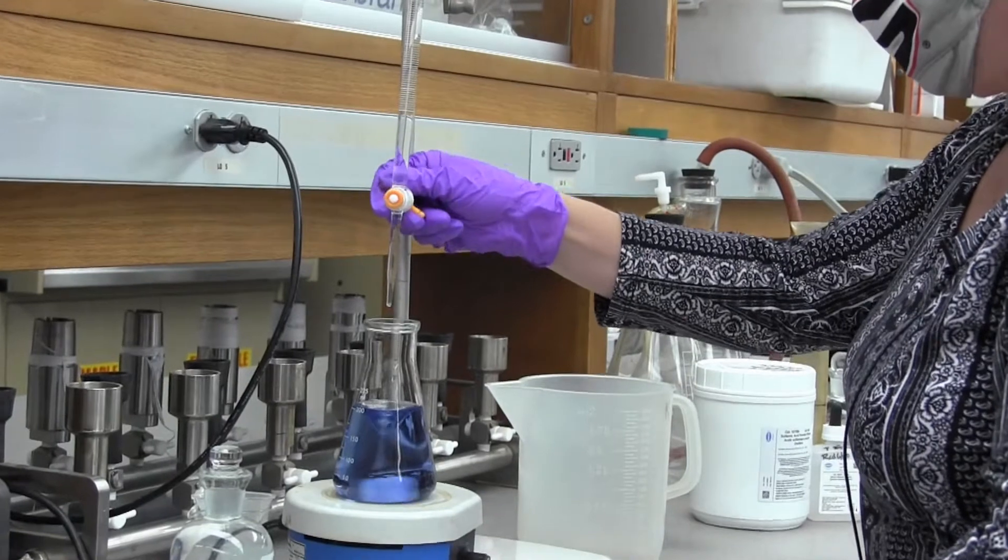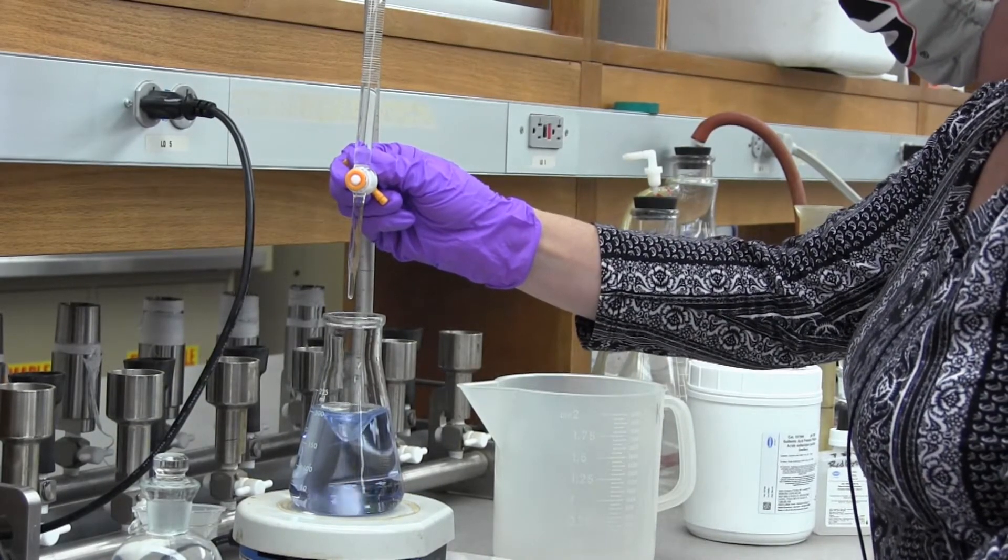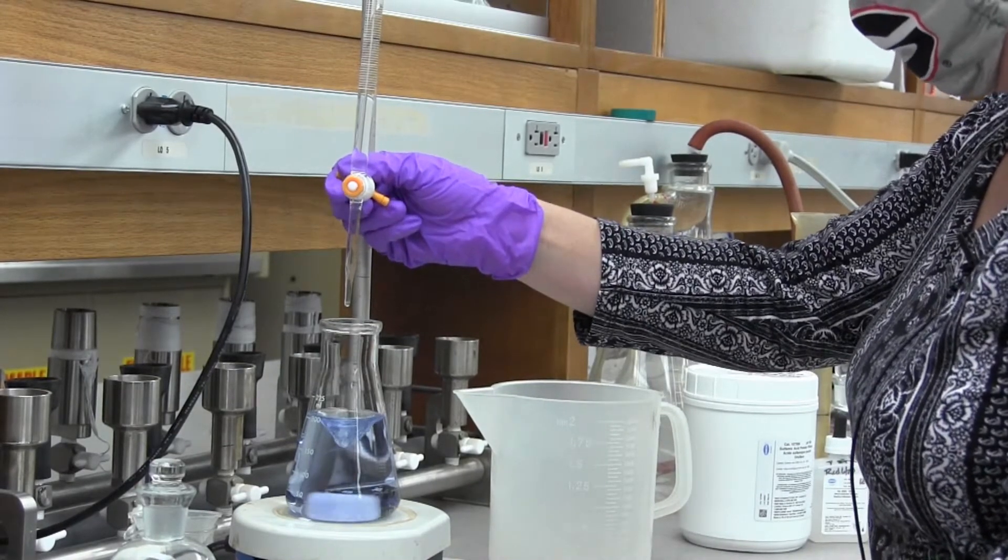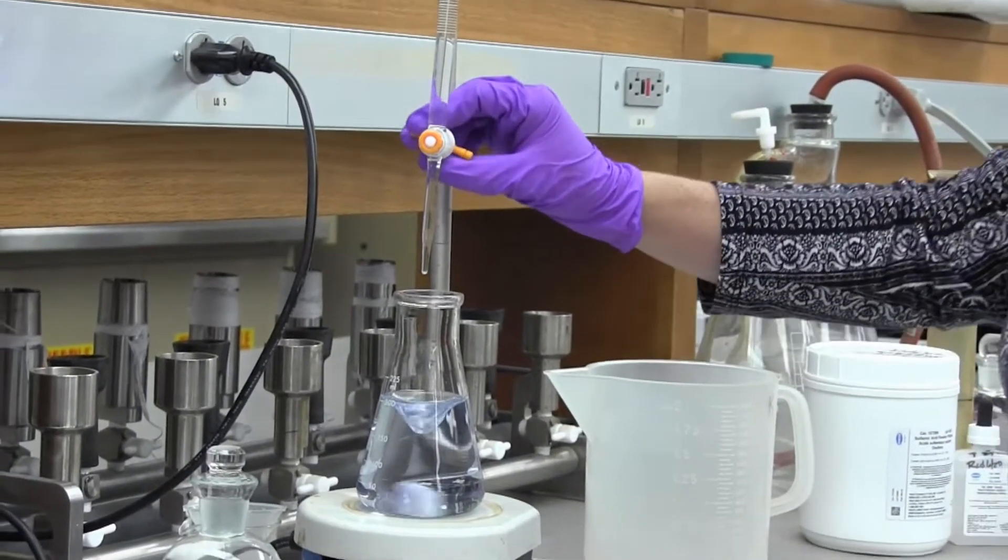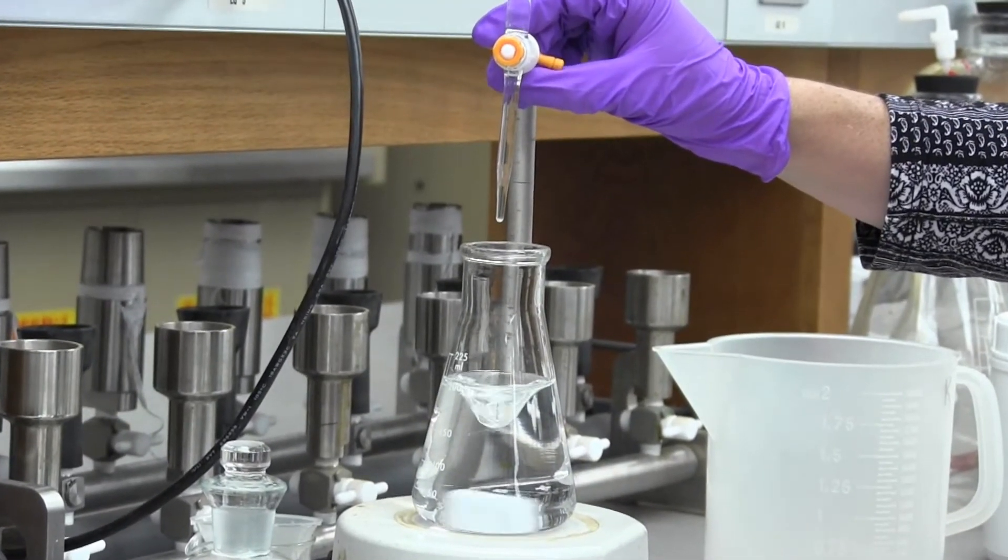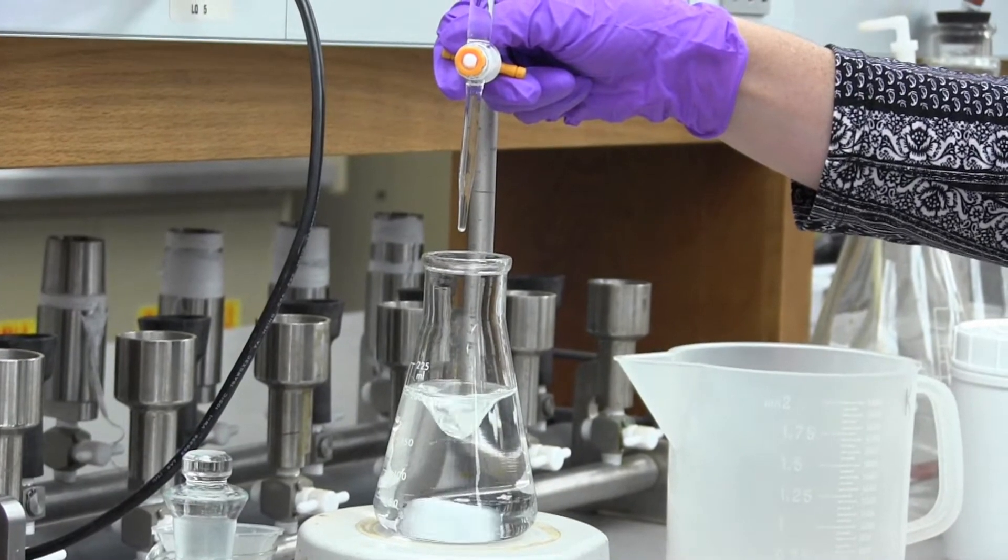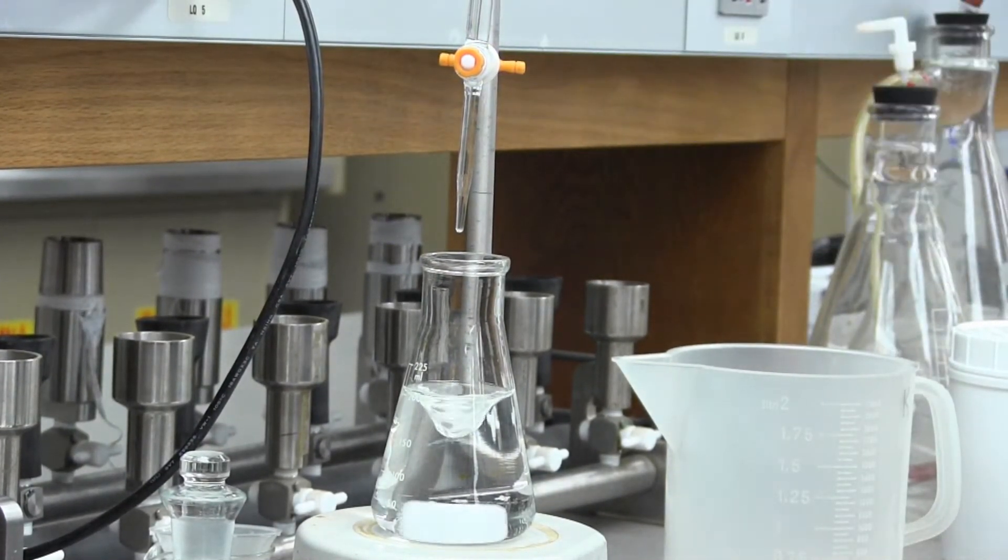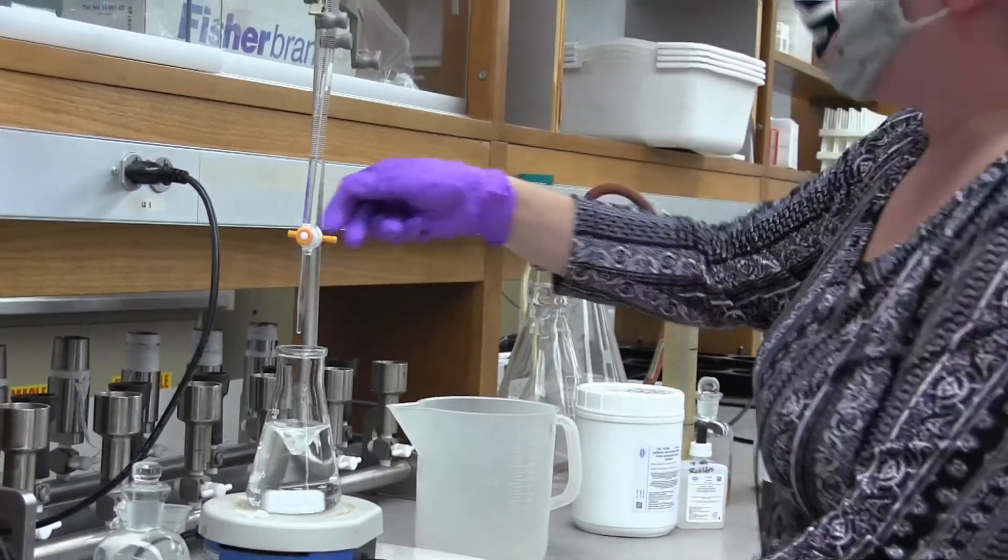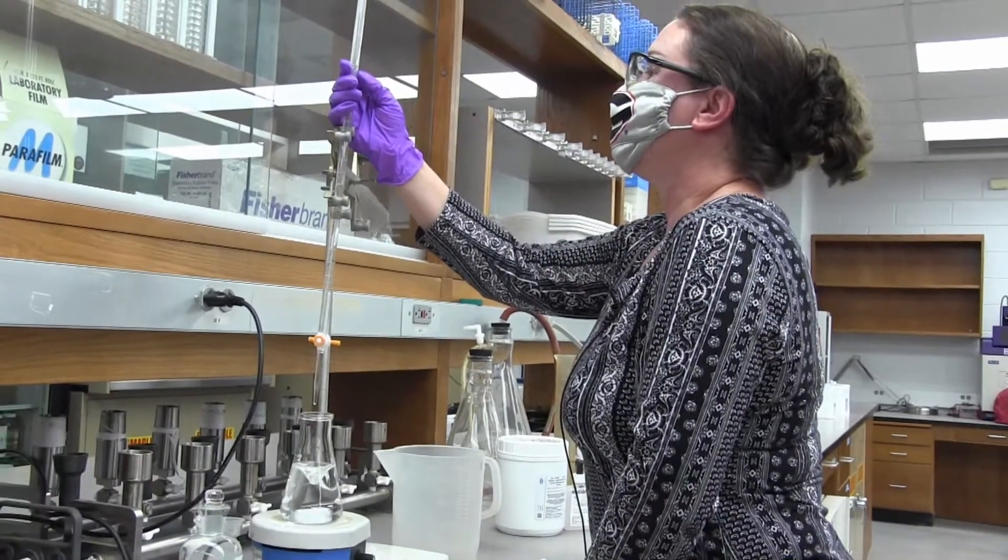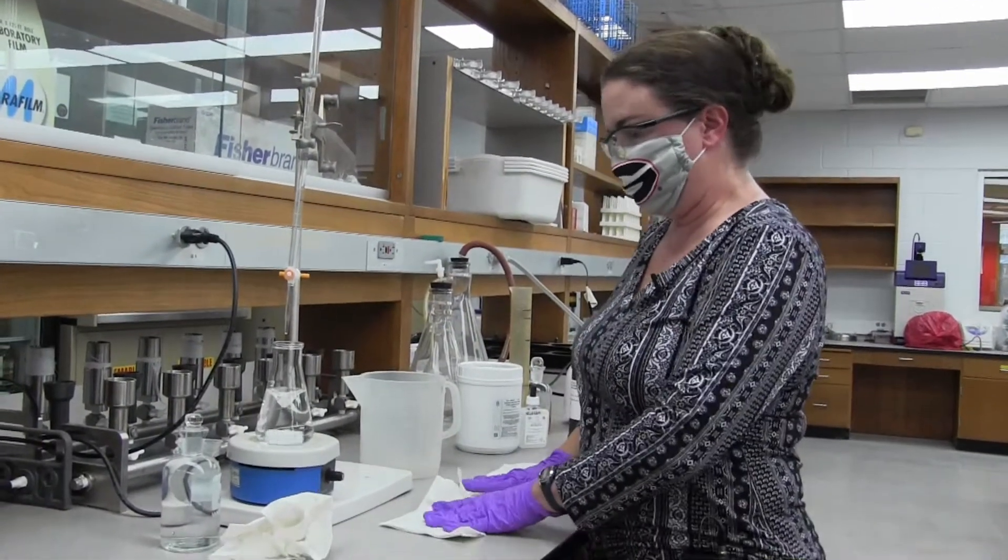The lighter it gets the slower you want to get. Just let it have time to develop first. Now I'm going to add one more drop. We are at 7.7, so we have 7.7 milligrams per liter DO dissolved oxygen in that sample.